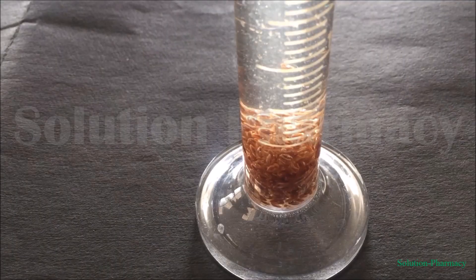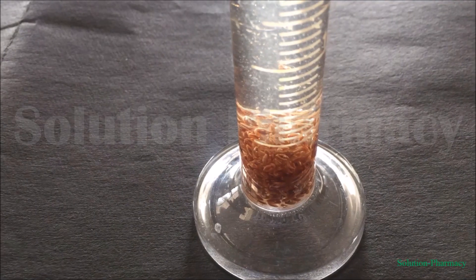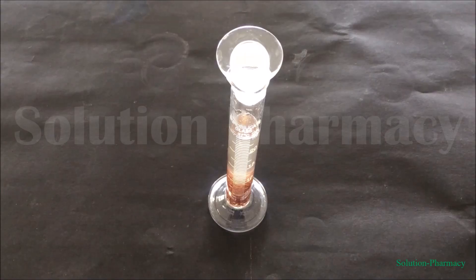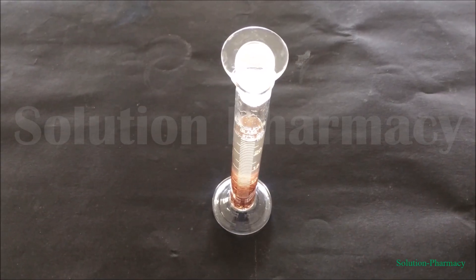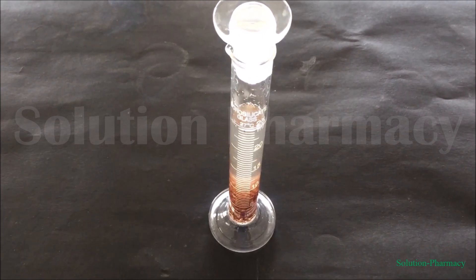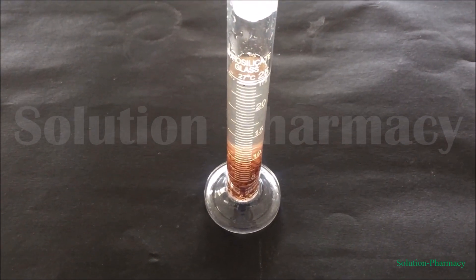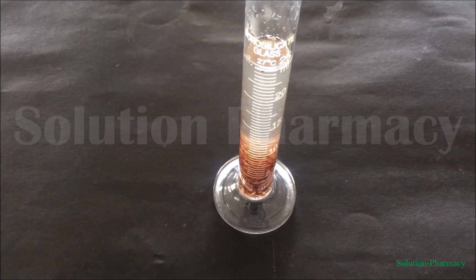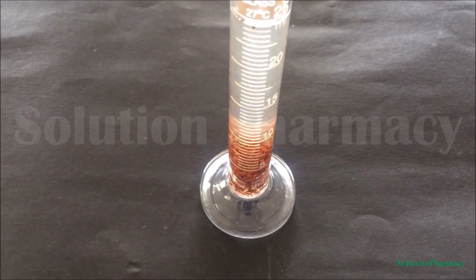Close the stopper of the measuring cylinder, shake vigorously, and shake it occasionally. Keep it aside for 24 hours for complete swelling. After 24 hours, you can see that the isabgol seeds have absorbed water and swelled, and the volume occupied by the seeds in the measuring cylinder has increased.